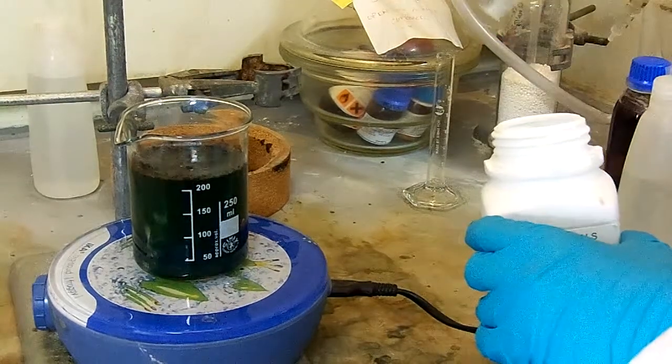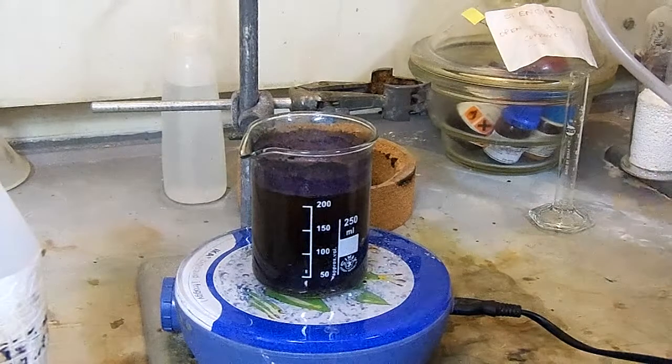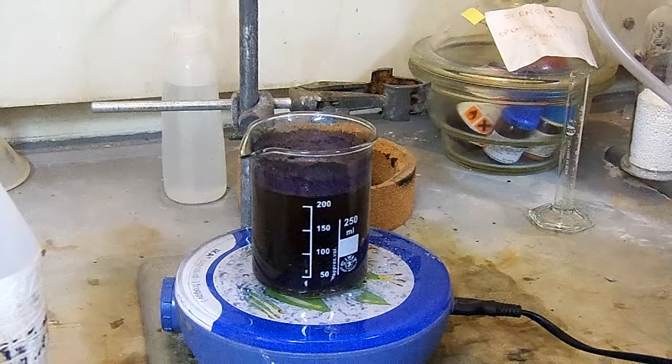The neutralisation is complete when the colour of the mixture has turned from green to purple and there is a small residual amount of sodium carbonate in the reaction flask.